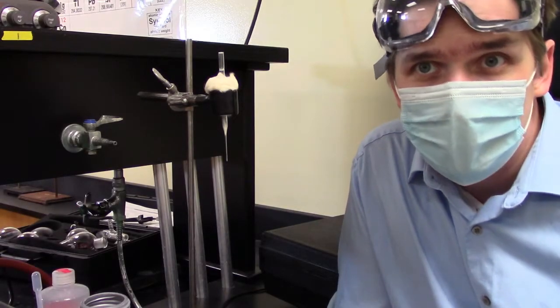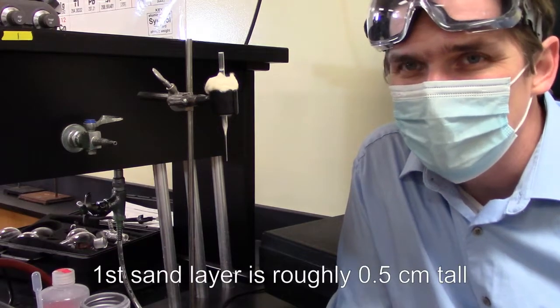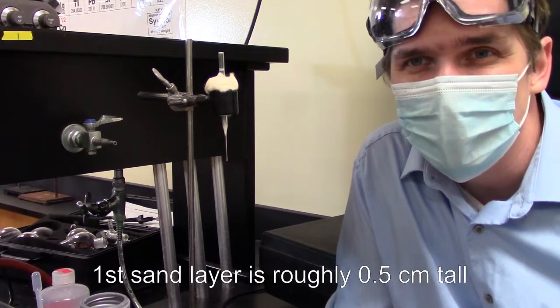Now, for the first sand layer, I want roughly half a centimeter of sand. This doesn't need to be measured precisely. Just keep it a half centimeter. The reason for this is the trade-off.